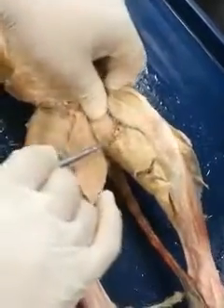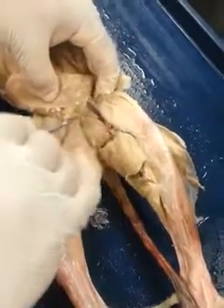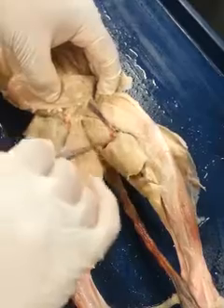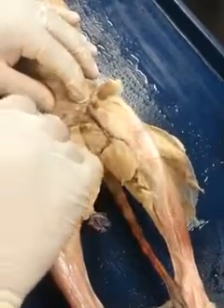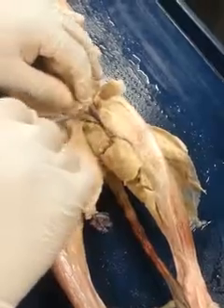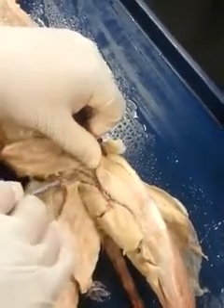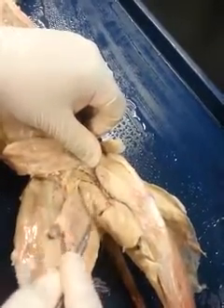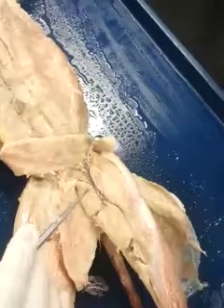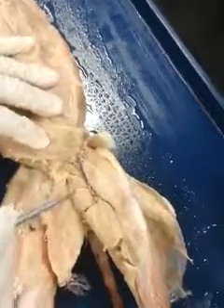So the adductors then are going to be these muscles, starting with the large adductor femoris, this whole muscle here, followed by the adductor longus, and then you have the pectineus. So pectineus, adductor longus, adductor femoris. And in humans, the adductor femoris is not present. We have instead the adductor magnus.